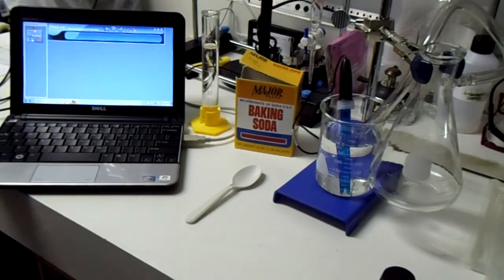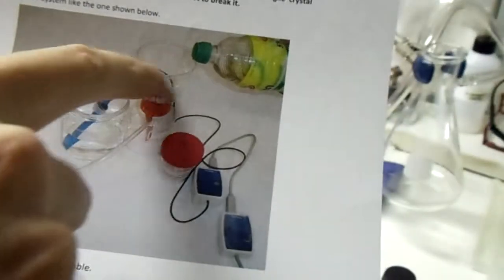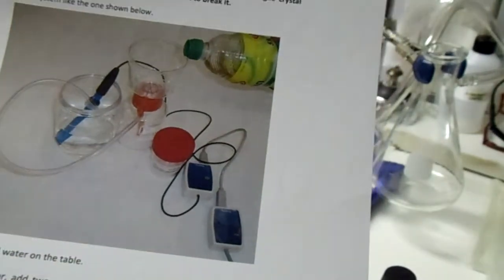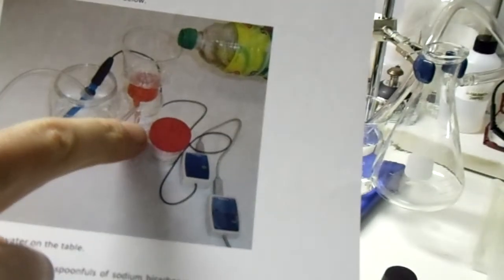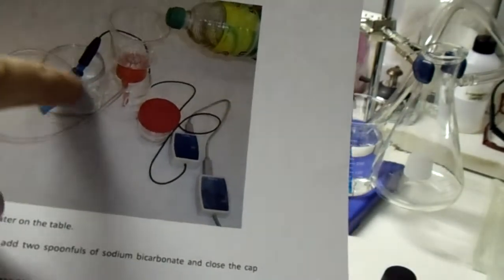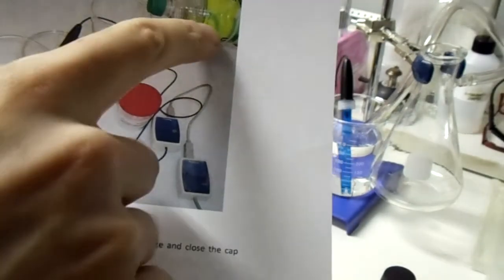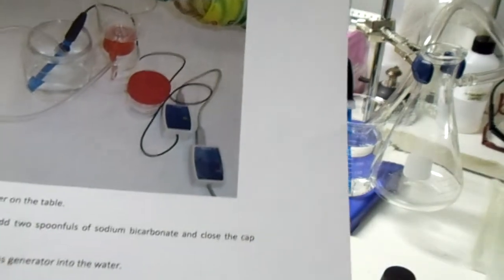If you're following along in the NeuLog guide, you can go to page 85 of the biology manual, and you will notice that there is this kit here where you have a container with a lid on it and a hose. You can set this up just the way it shows. The sodium bicarbonate goes into the chamber. You then cap it off. You run the hose into a water bath before you run the experiment, of course, and then you throw in your pH wand, and later you will add the vinegar to the top, of course, to begin the reaction.